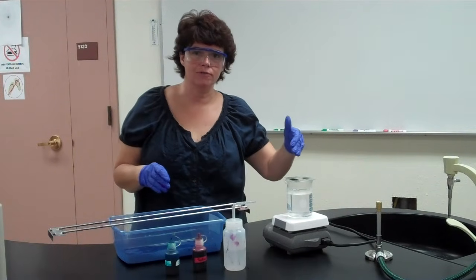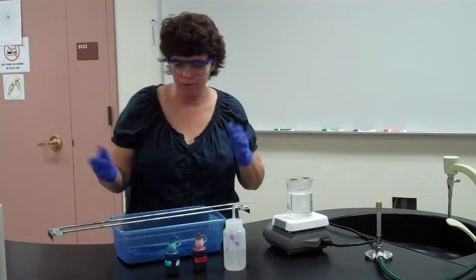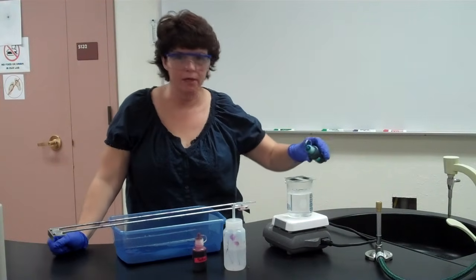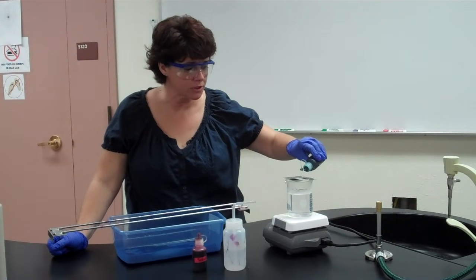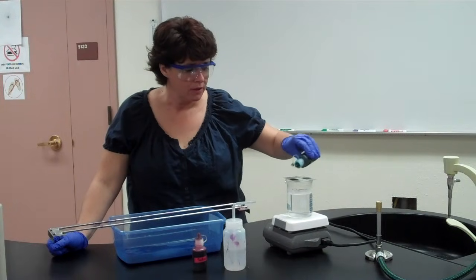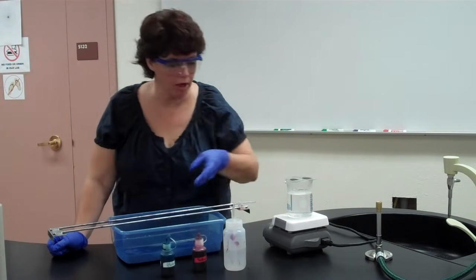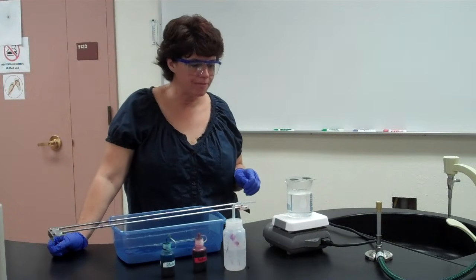That is going to steam for the 5 minutes. During that time, you can do whatever else you need to do. Remember to watch it. So don't just walk away and come back 5 minutes later. You want to watch it. If it starts to dry out, you add more stain. Once again, I don't want it running over and have a bunch of green water, okay? So that's going to steam for 5 minutes.